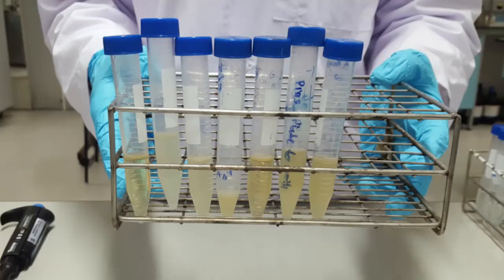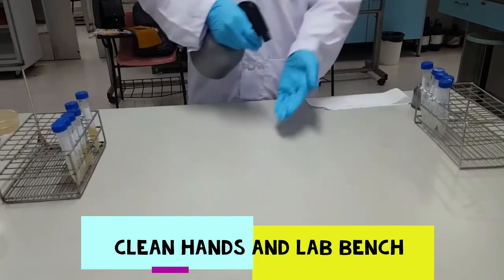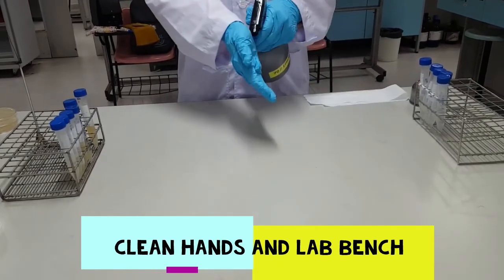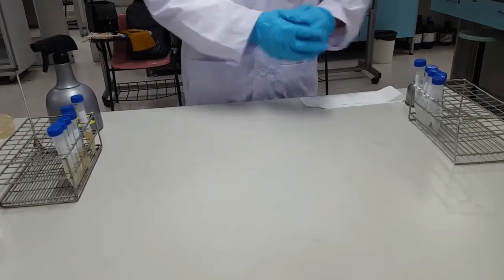You're going to want to keep diluting from the first to the second one. Go through the same steps that you used for the first one, then go from the second to the third, and so on until you finish 7 test tubes. Now you're going to want to spray down your lab bench and your hands once more with that 70% alcohol to be sure all the microorganisms are killed.